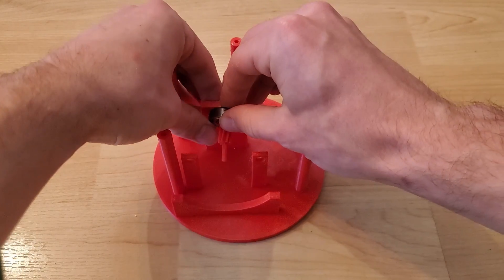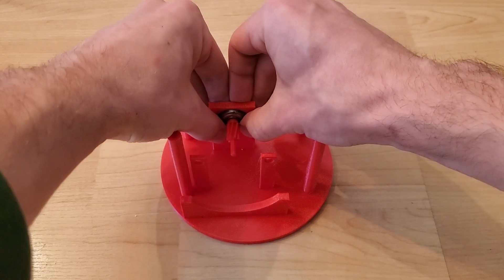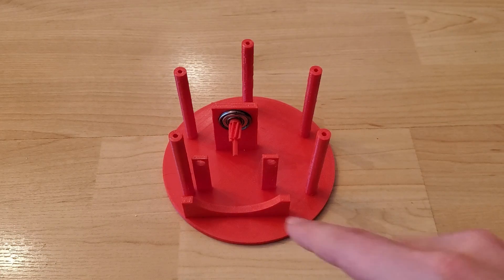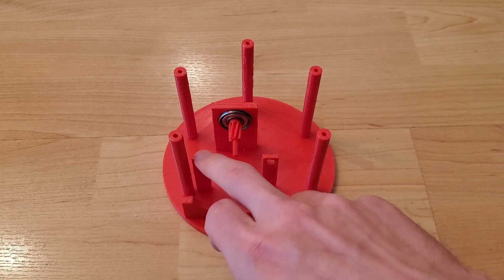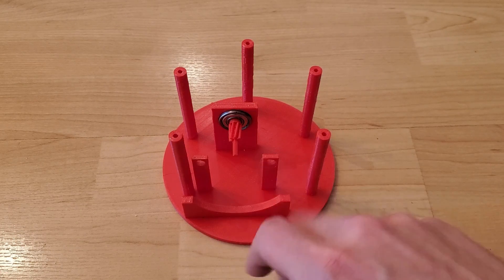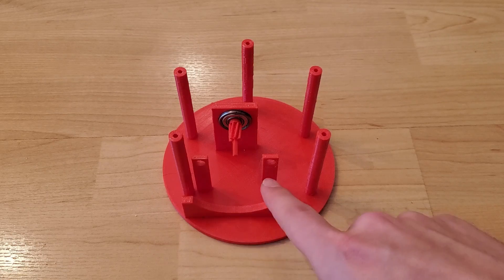The bearing will slide into the mount here. The speedometer can then be attached through these two screw holes and it'll rest on this lower bracket as well.